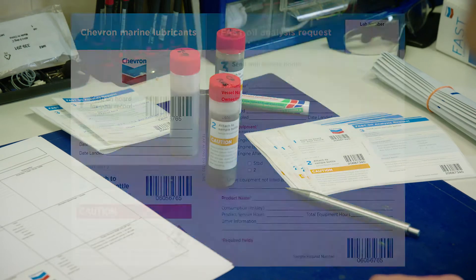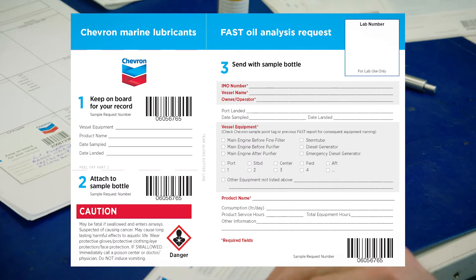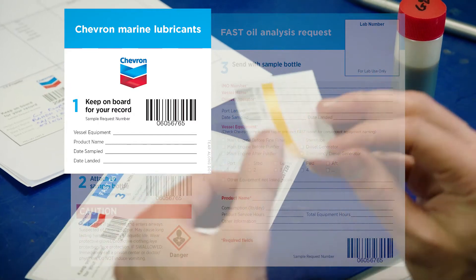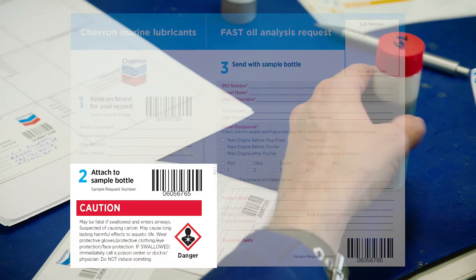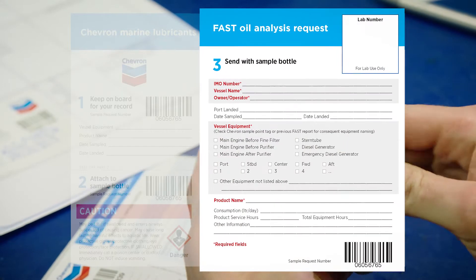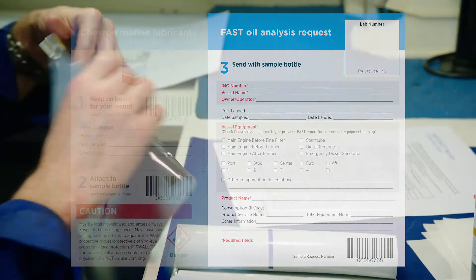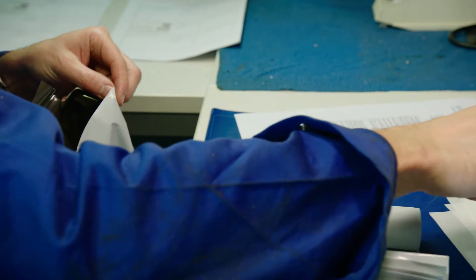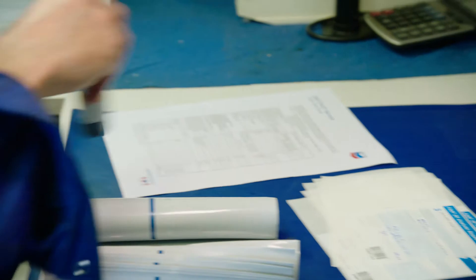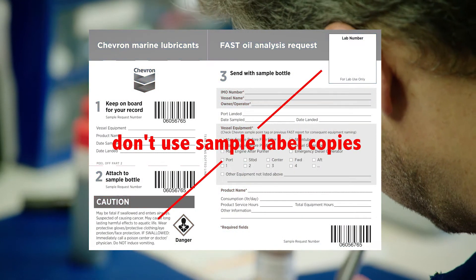Accurate labelling is a vital part of the sampling process. Each pre-numbered label has three sections. Section 1 is for the ship's record and is retained on the vessel. Section 2 must be peeled off and attached to the bottle. Section 3 must be completed in full. Send samples to the Chevron Marine Lubricants Laboratory with the correct bottle and paperwork using the bag and addresses provided in the sample kit. Only use the original FAST labels which contain a unique request number. The lab cannot accept copied labels.